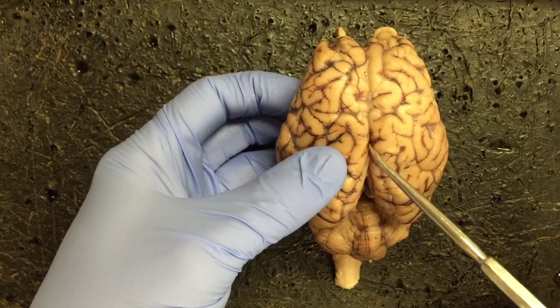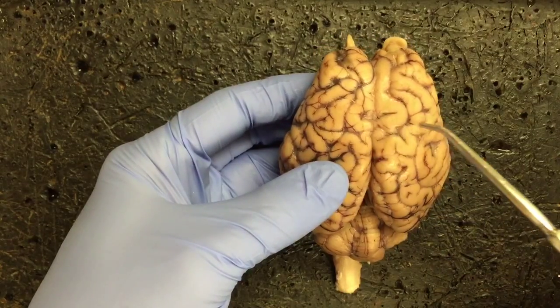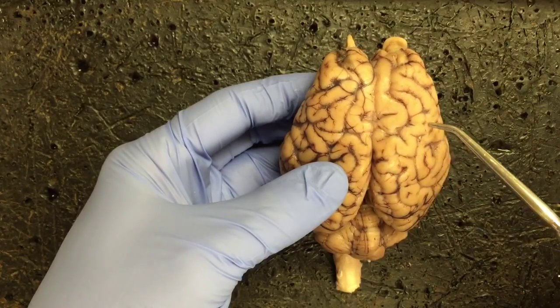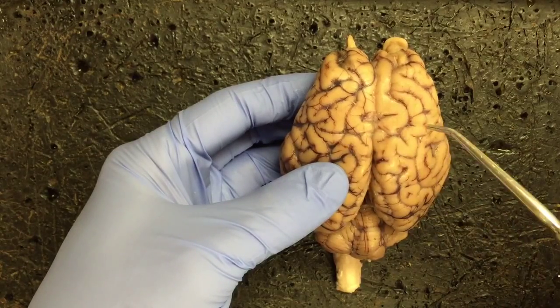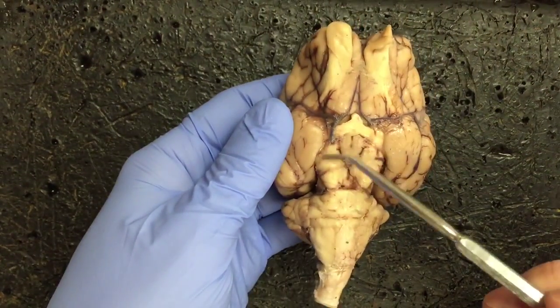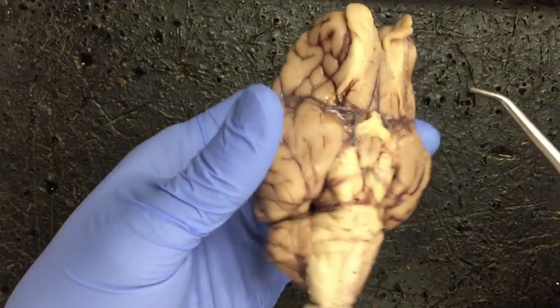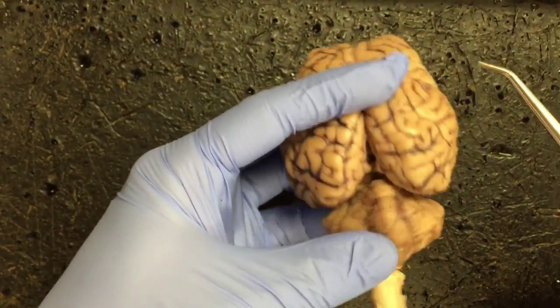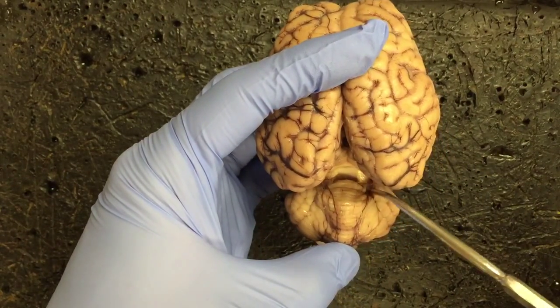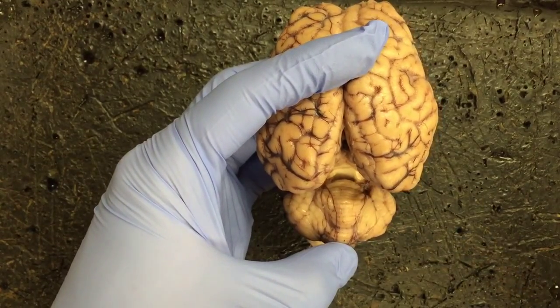The two halves of the brain are separated by the longitudinal cerebral fissure. Going across is the cruciate fissure, and actually that's where the term cruciate comes from, because it makes a cross that goes across the brain. Going back to the ventral view, we have the cerebral peduncles, there and there. And then finally, we can show ourselves the posterior choroid plexus. If we separate gently the cerebellum from the cerebrum, this kind of brownish mass of tissue at the roof of the fourth ventricle would be our posterior choroid plexus.